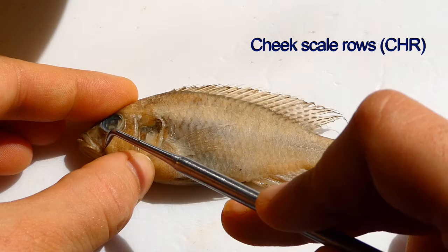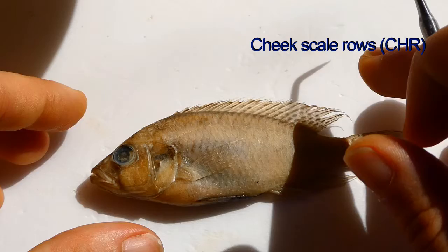The next thing to do is count the number of cheek scale rows. So all the rows of cheek scales here — count how many there are. So there are 3.